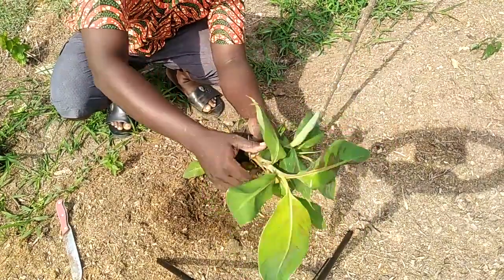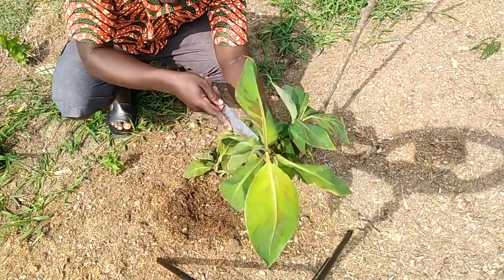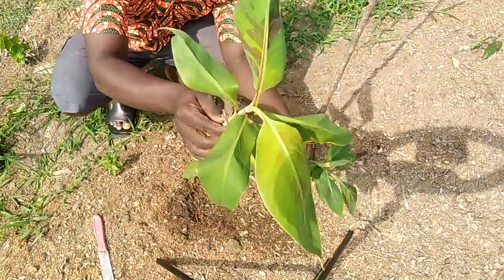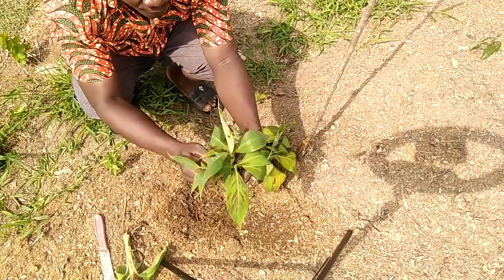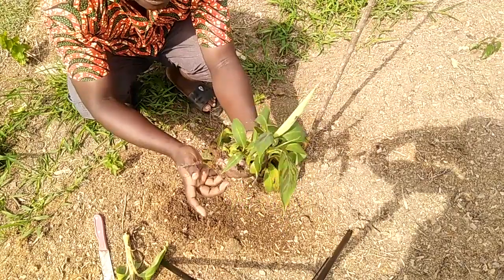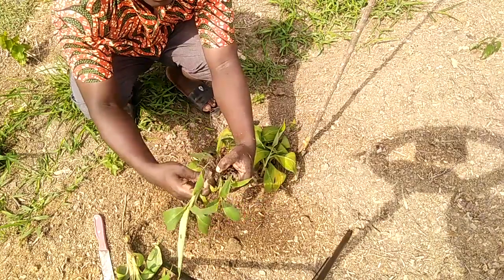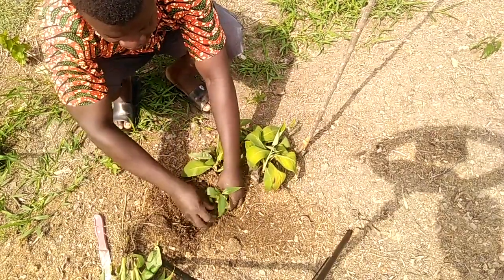Let's count and see. One — you see that this one is a bit bigger, you can even separate it. So this is one, two, three, four, five, six, seven. We had seven seedlings from this one. All these ones we can separate. After separating these ones we still put the rest back.